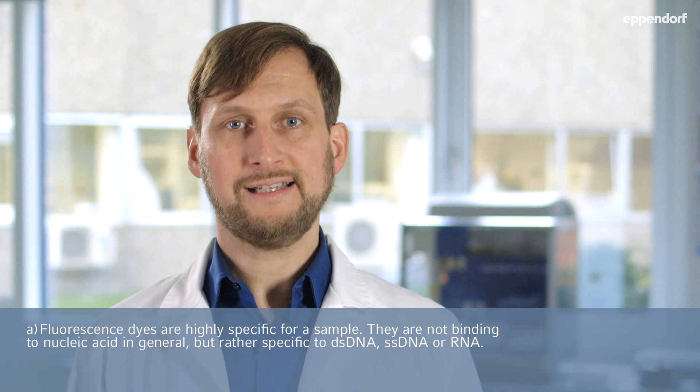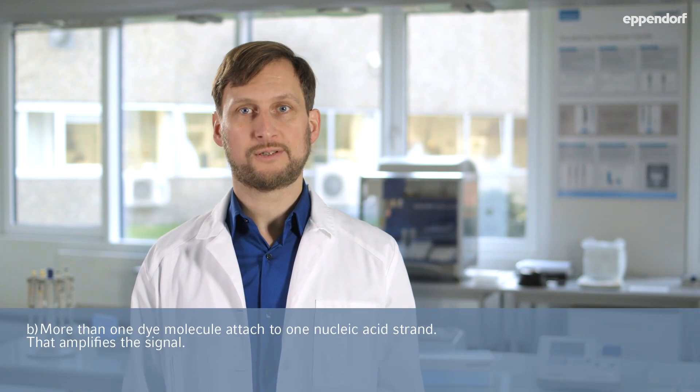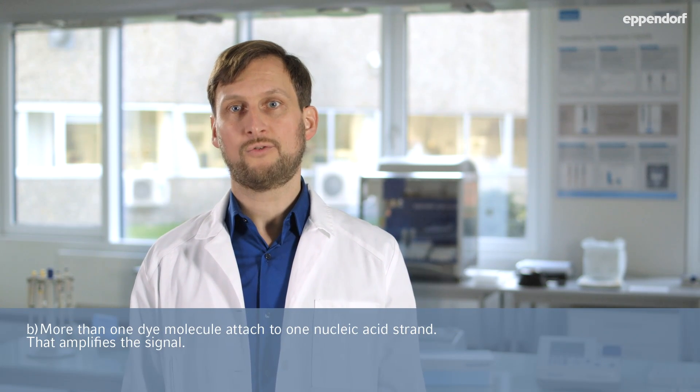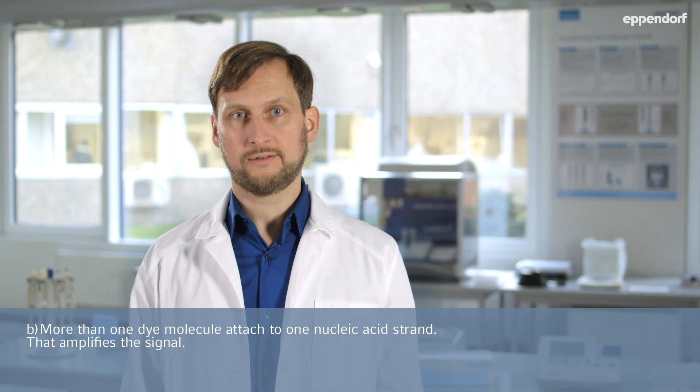When nucleic acid quantification is performed using absorption measurements, the signal measured will include all nucleic acids present in the sample, regardless of what type. More than one fluorescence dye molecule can attach to a nucleic acid strand, which amplifies the signal. This is the reason for the higher specificity and sensitivity of fluorescence detection when compared to photometric absorption measurements.